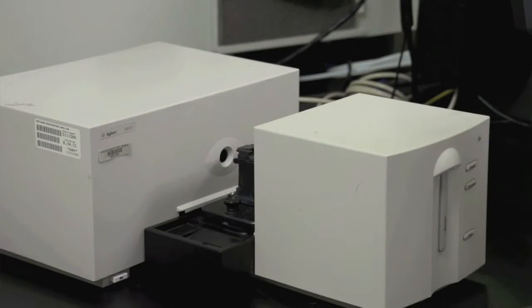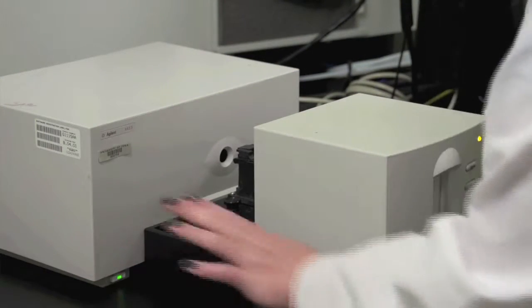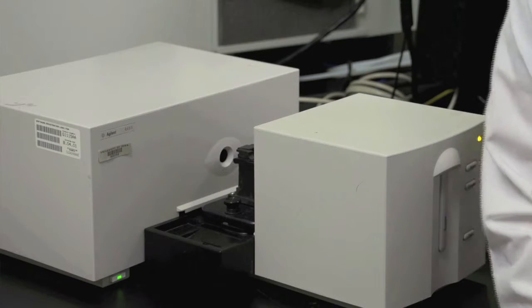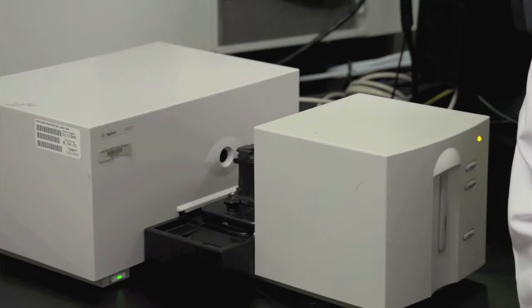When you get to lab, you should turn on the spectrophotometer. Let the deuterium and tungsten lamps warm up for at least 8 to 10 minutes before taking a sample.